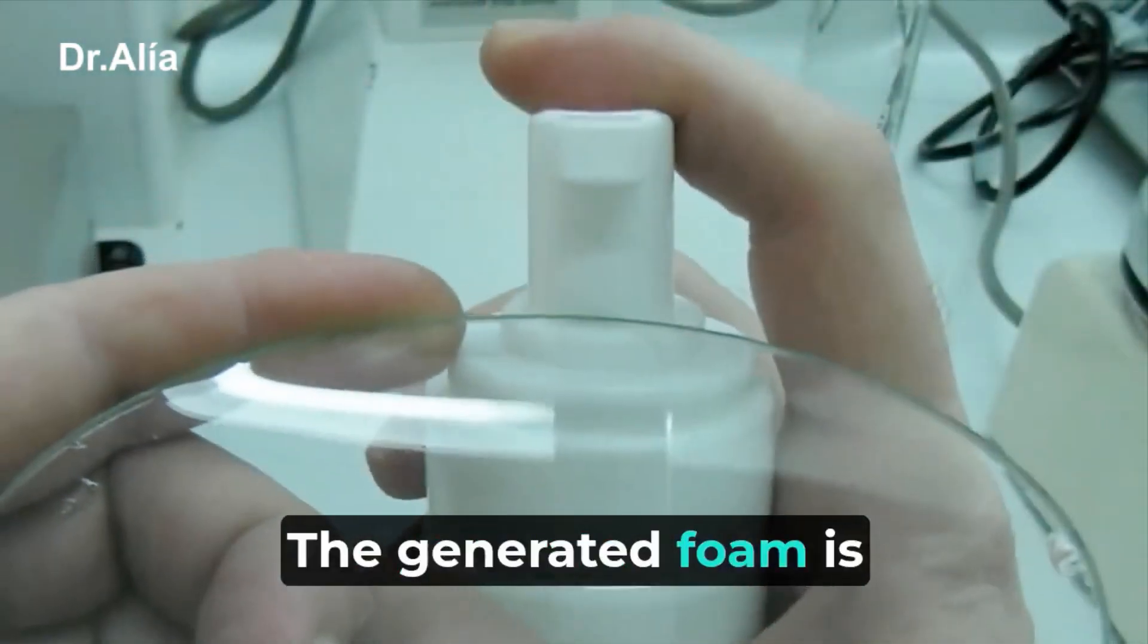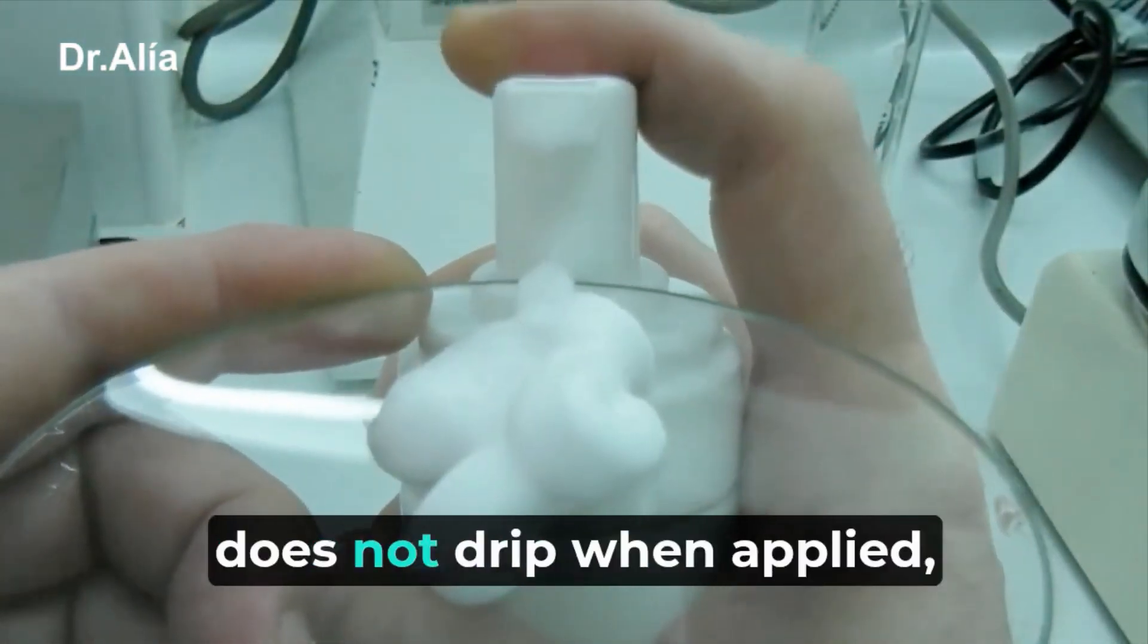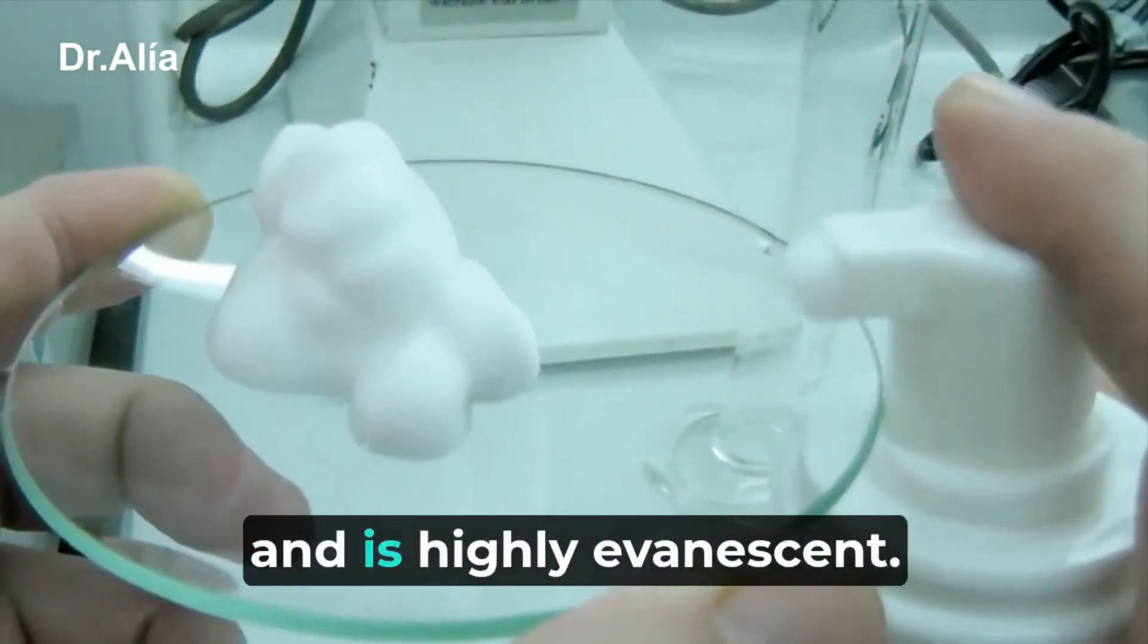The generated foam is rich and creamy, does not drip when applied and is highly evanescent.